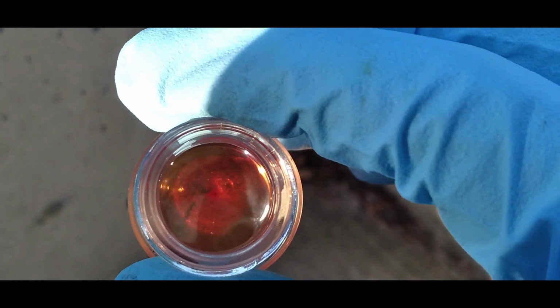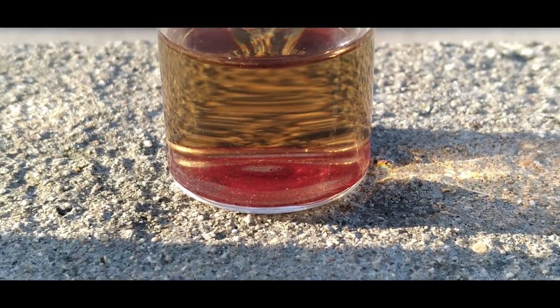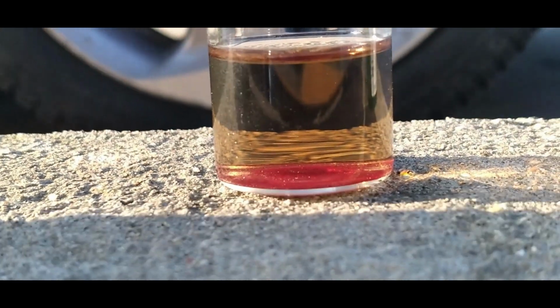Looking back, I kinda wish that I had added ammonium chloride to this solution before trying to boil it down, and I'll definitely try doing that in a future video. However, I stumbled upon a different reaction. That is the reaction of excess ammonia with these hexachloroosmate solutions.